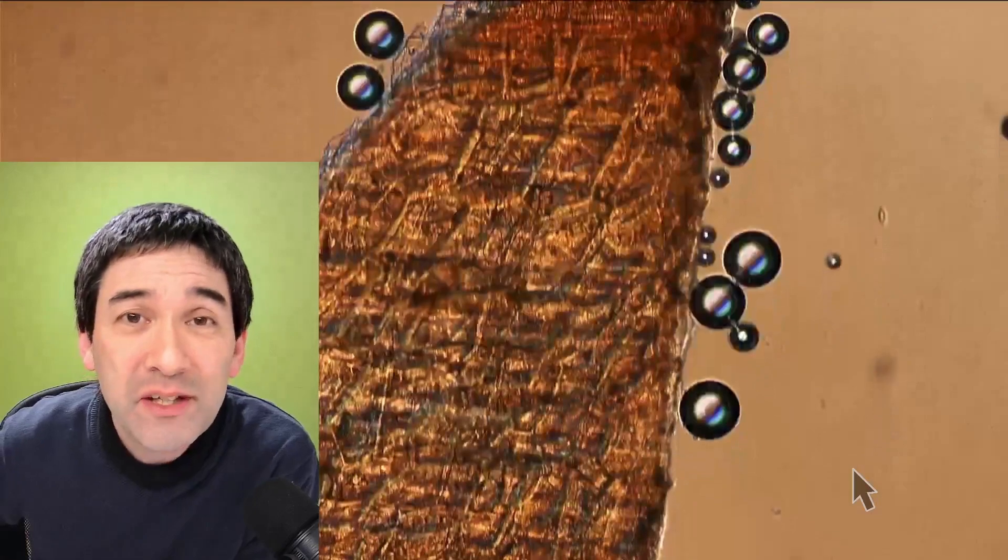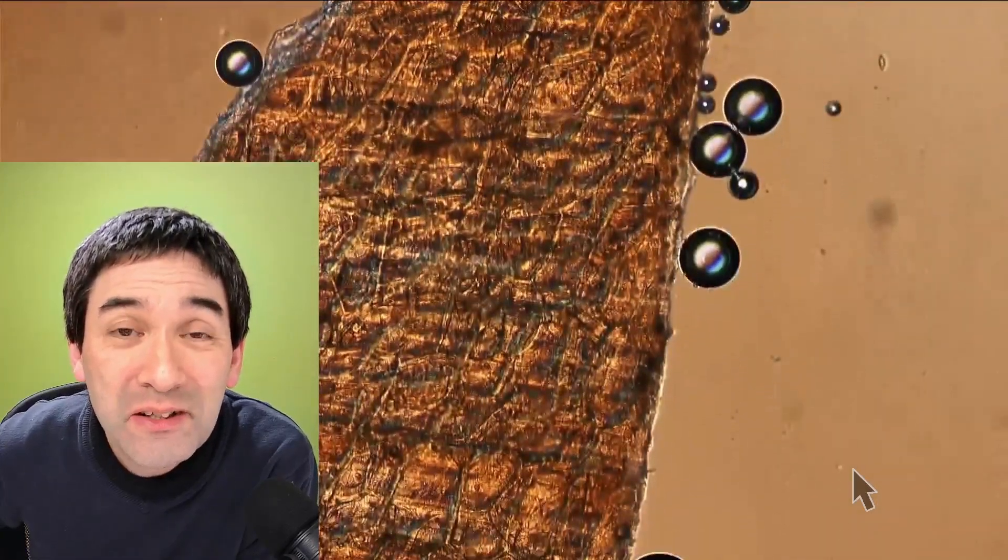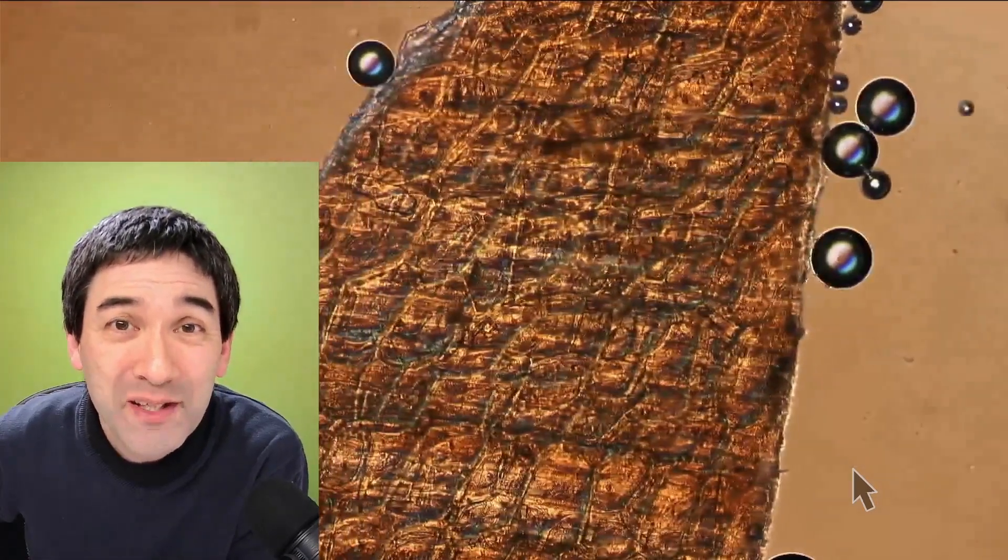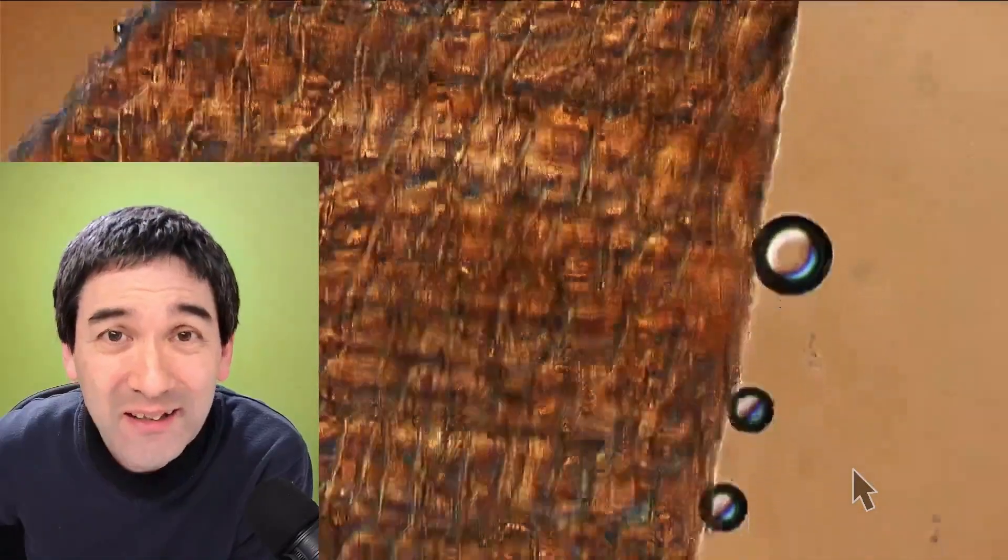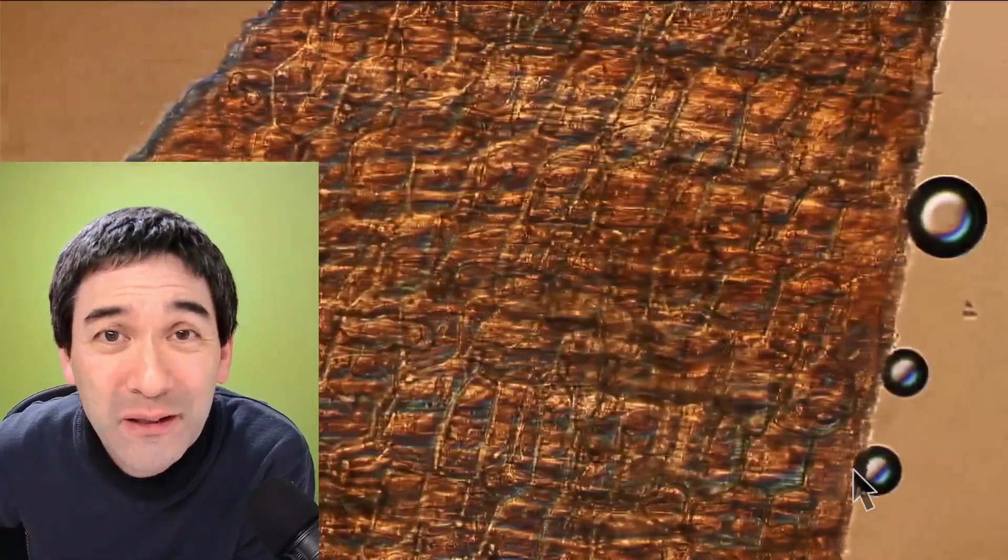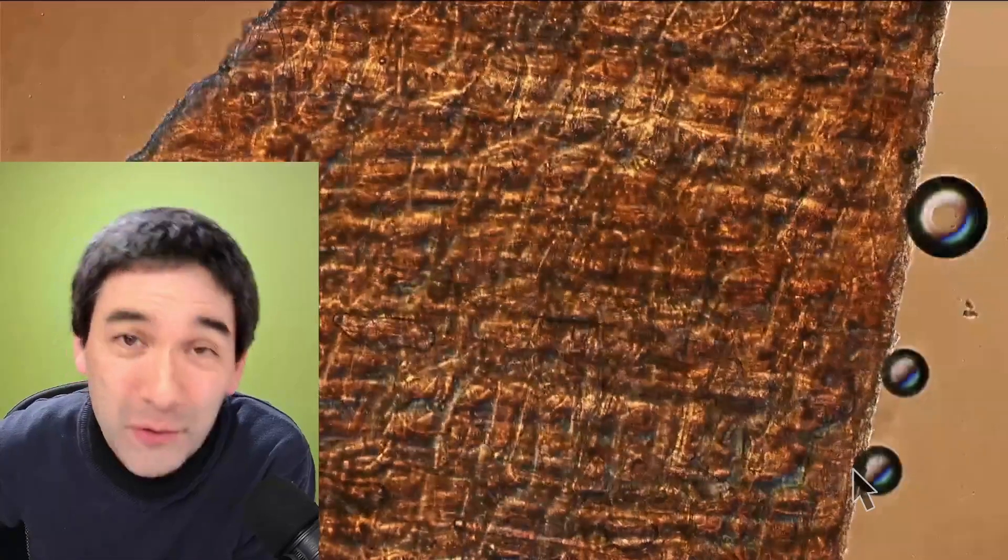bubbles there and you see that the onion tunic, the onion skin, is also not quite as transparent as when using oil. So in that sense you can see that sometimes different mounting media are better suitable than others.